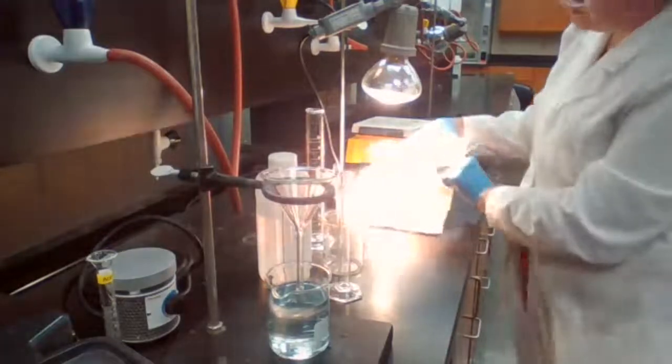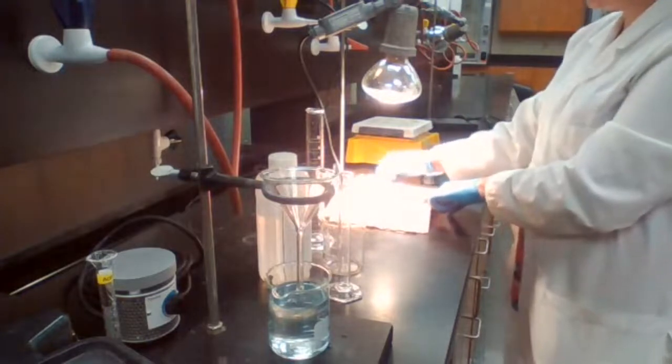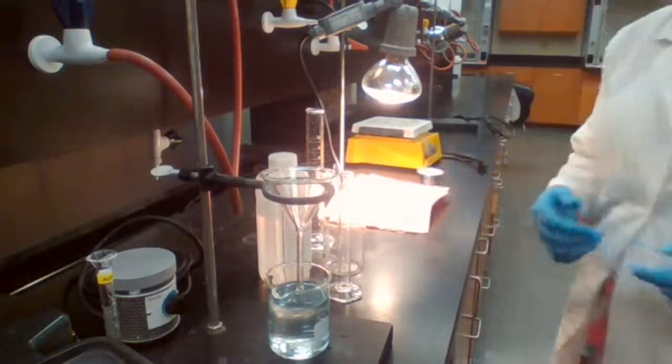See? It absorbs the water, and then the heat from the top will dry up the copper. We don't want to measure the mass of the copper while it's wet, because then we would think that we were alchemists. We started with 0.4 and we end up with more than what we started with, which is impossible, right? Because we are studying the law of conservation of mass.